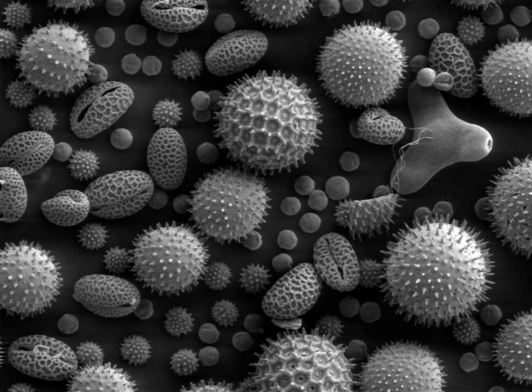Measurement of the energy of photons emitted from the specimen is a common method to get analytical capabilities. Examples are the energy dispersive X-ray spectroscopy detectors used in elemental analysis and cathodoluminescence microscope systems that analyze the intensity and spectrum of electron-induced luminescence in geological specimens. In SEM systems using these detectors, it is common to color code these extra signals and superimpose them in a single color image so that differences in the distribution of the various components of the specimen can be seen clearly and compared. Optionally, the standard secondary electron image can be merged with one or more compositional channels so that the specimen's structure and composition can be compared. Such images can be made while maintaining the full integrity of the original signal data, which is not modified in any way.